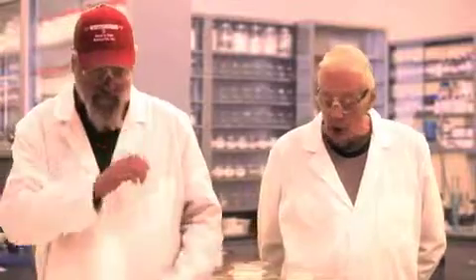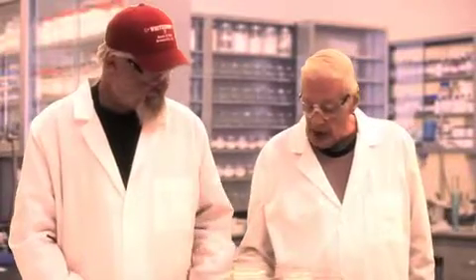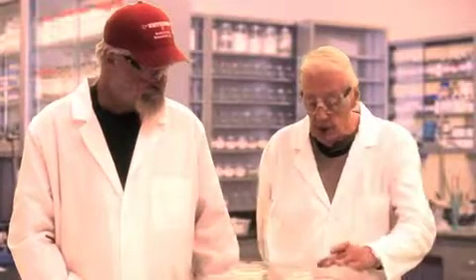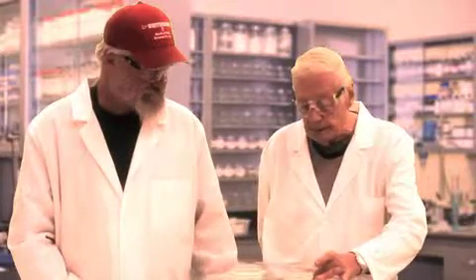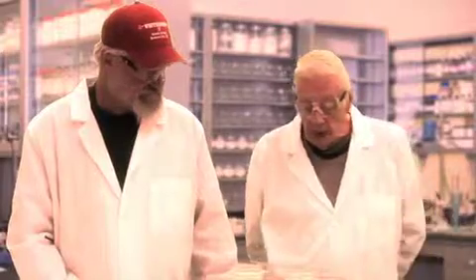So we're now ready to do that, and I'm going to turn the stirrer on here and get the magnetic stirrer moving to mix that solution. That way we create intimate contact between the solvent exchange chemical and the reducing solution so that the reducing solution has a chance to reduce all the gold that's present in the solvent exchange chemical.